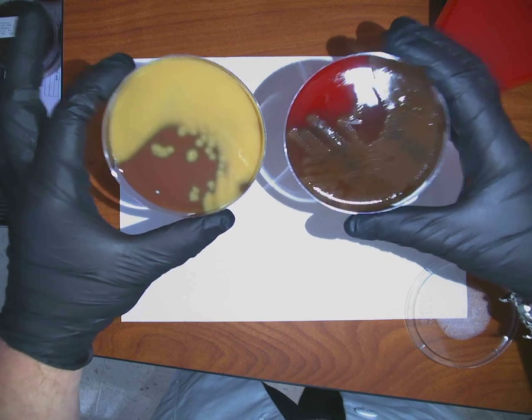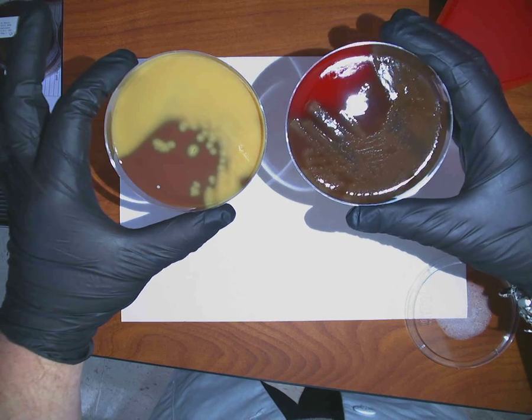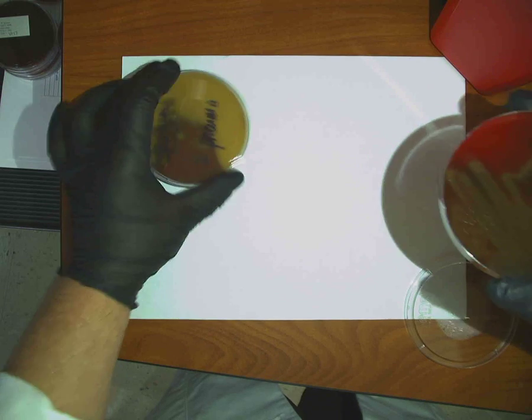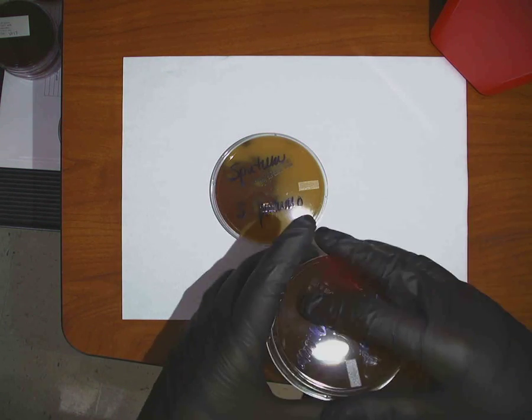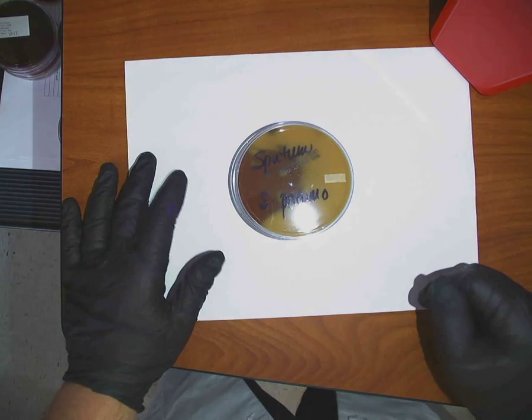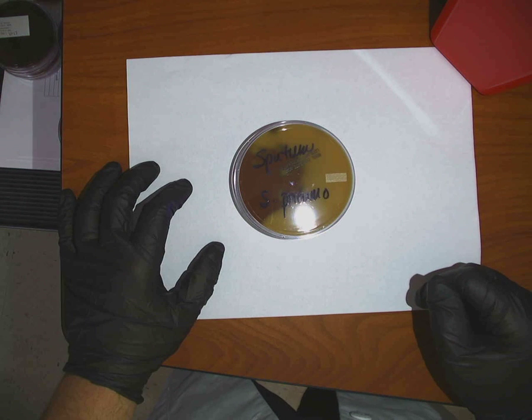So based upon its catalase reactivity and its hemolytic pattern, what's the next test that's needed? A P disc, okay? So you suspect that this is Streptococcus pneumoniae, and that's right. That's exactly what you would need to do for Streptococcus pneumoniae. The P disc would be considered sensitive or susceptible, okay? You would see a zone of clearing around the disc, and I don't have one set up, but that's what you would see, okay? All right.